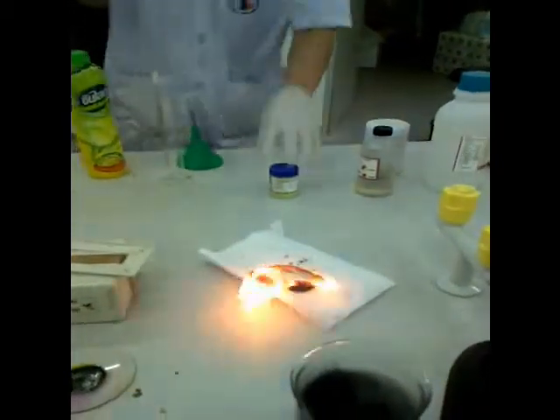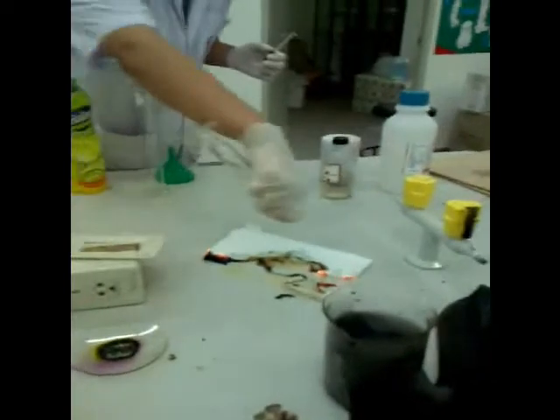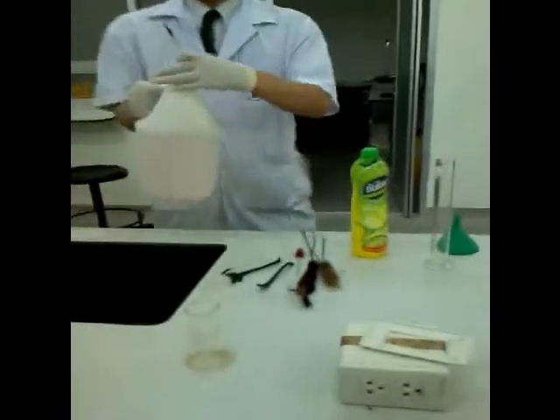Oh, my God. Oh, my God. Oh, shit! Oh! Oh, shit! Oh! Oh! Oh, my God! Look at this.